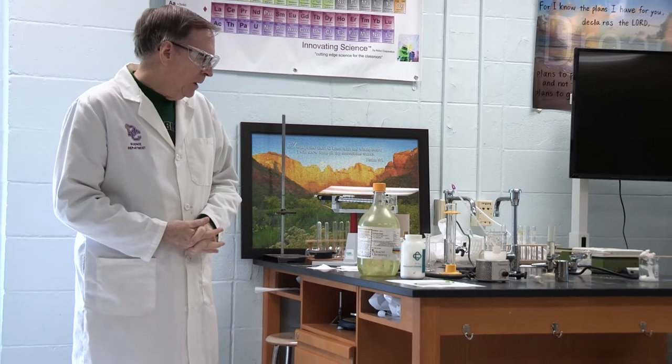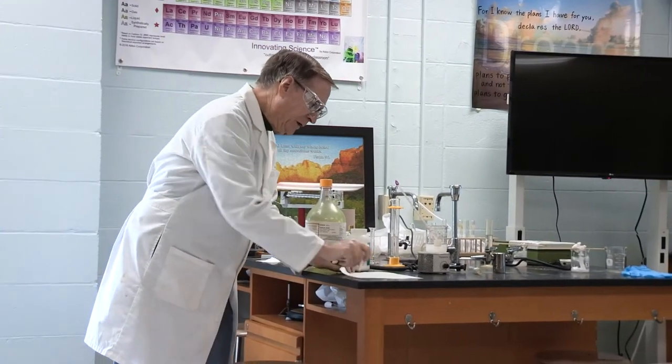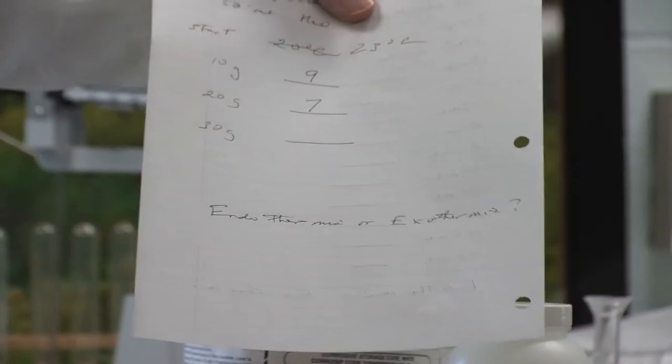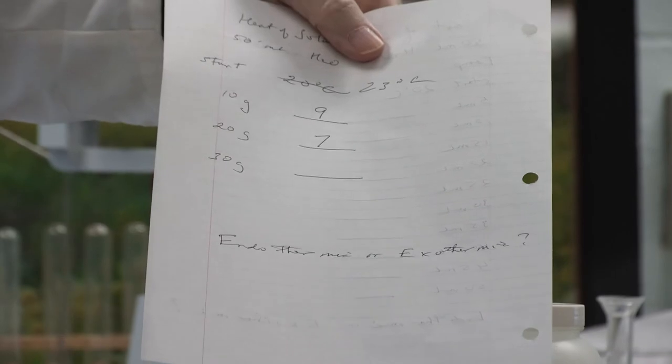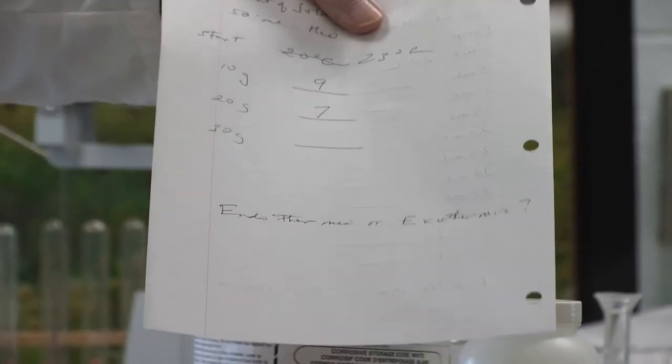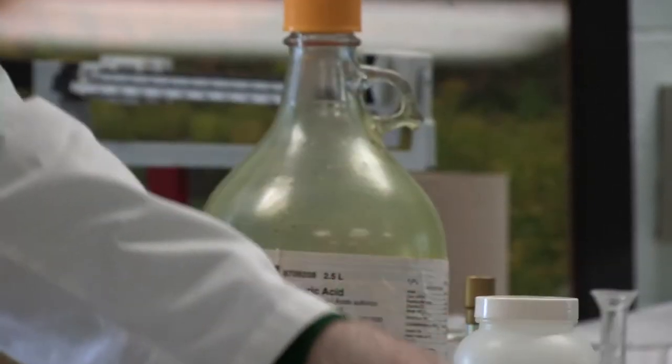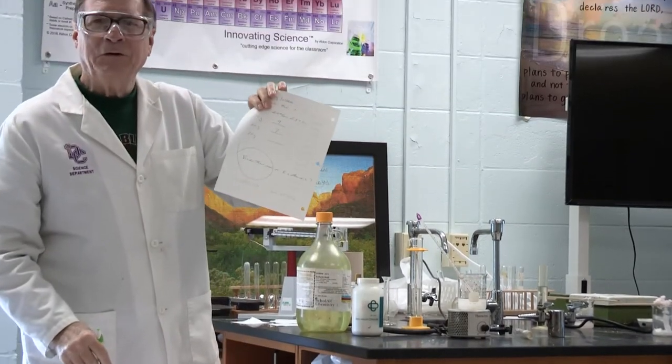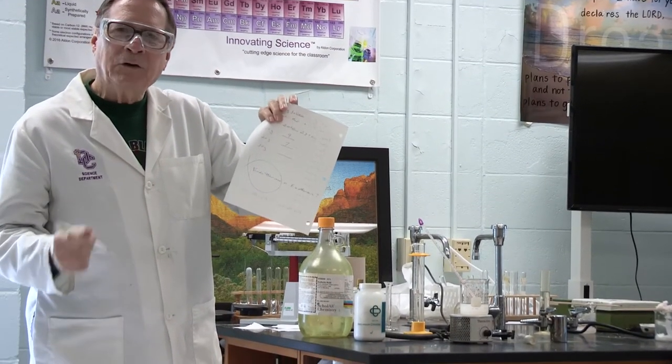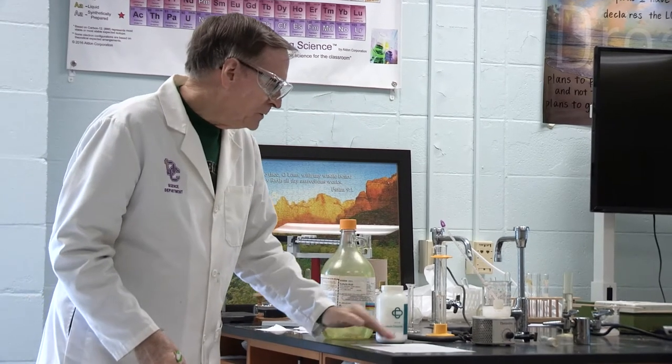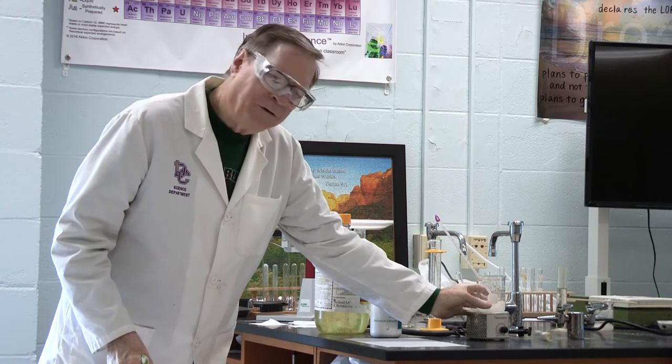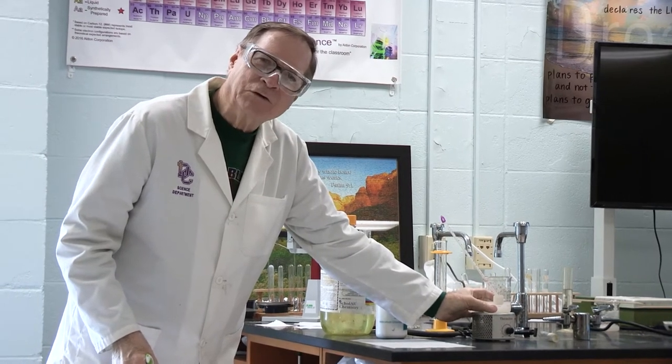If we added another 10 grams to it, do you think it would make any difference? The answer is probably not because I've already reached a saturation point. The question is, is this endothermic or exothermic? What do you think? If you said endothermic, you got it right. Why do I know it's endothermic? Because the beaker got cooler. Oh boy, is that cool. That is like almost out of the freezer cold.